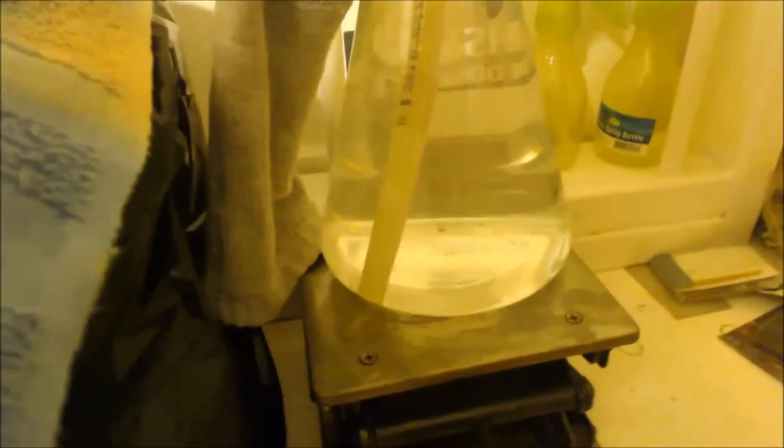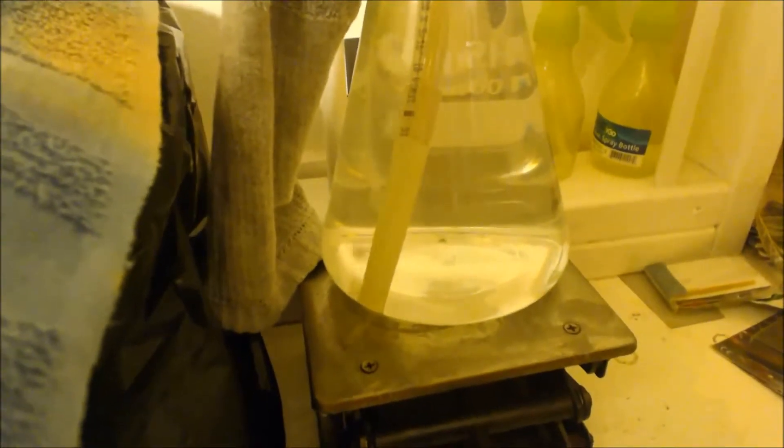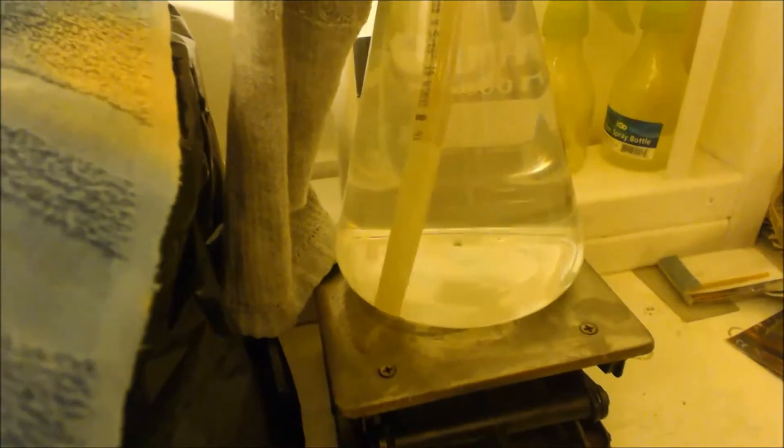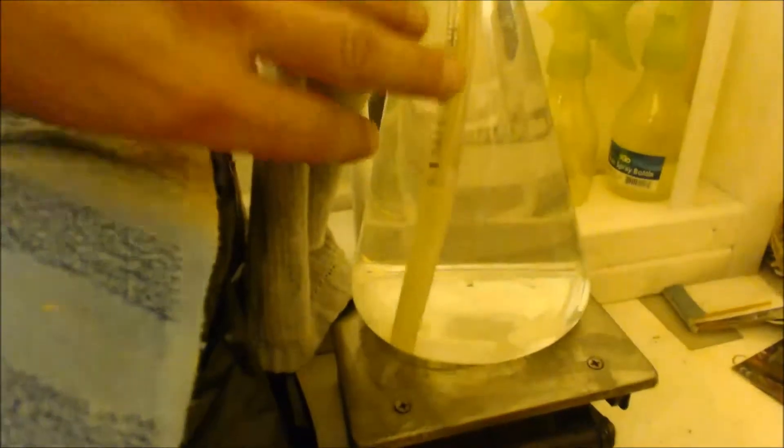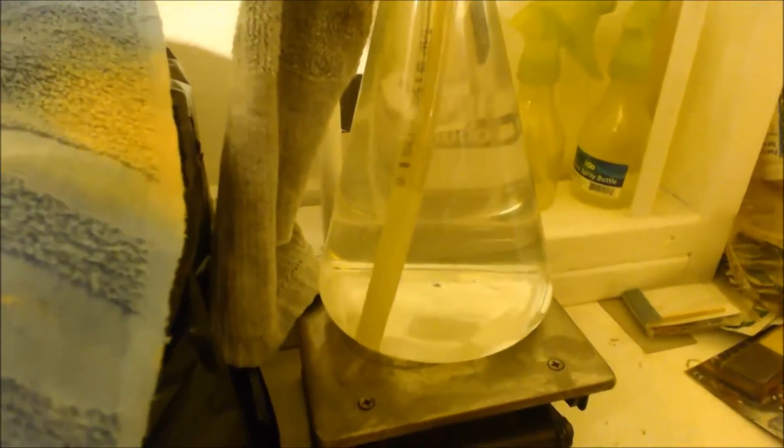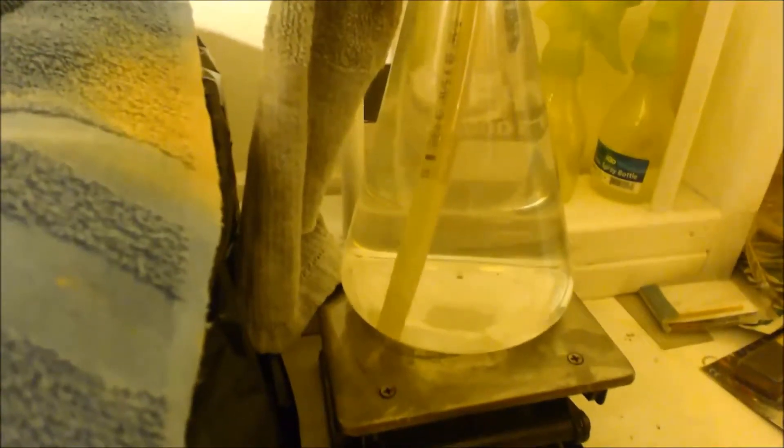But what really is helping today is this. I put sodium hydroxide in here. So instead of making nitric acid, I just figured it took so long to make the nitric acid, I could remake it. Because you're wasting a lot of this. You only need like three moles. I'm putting six, or six times as much or something like that. Because most of it's wasted. But you can see it's totally clear up on top. And this is making, maybe not a good ratio, but it is making sodium nitrite, not nitrate. And I do want some sodium nitrite. So I'm going to save this bottle of sodium hydroxide. And every time I do something where I make NO2 gas, I'm going to bubble it into it.